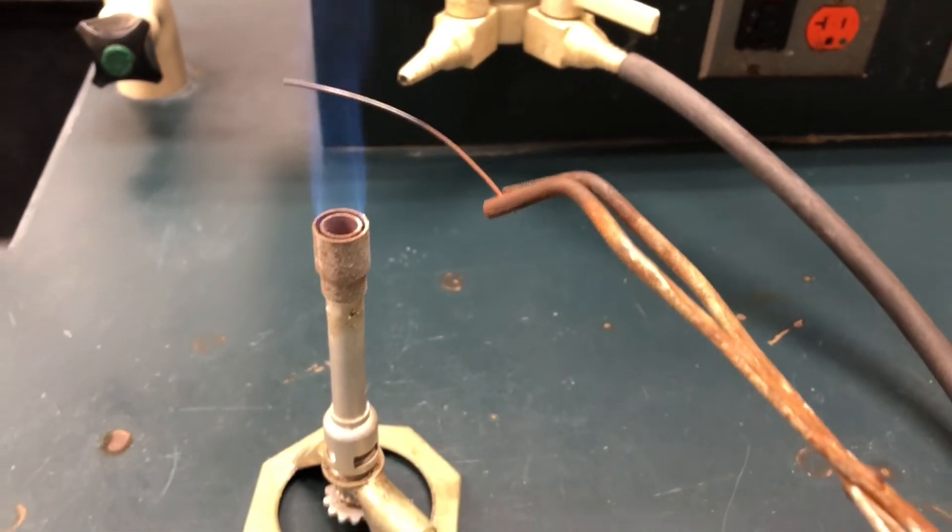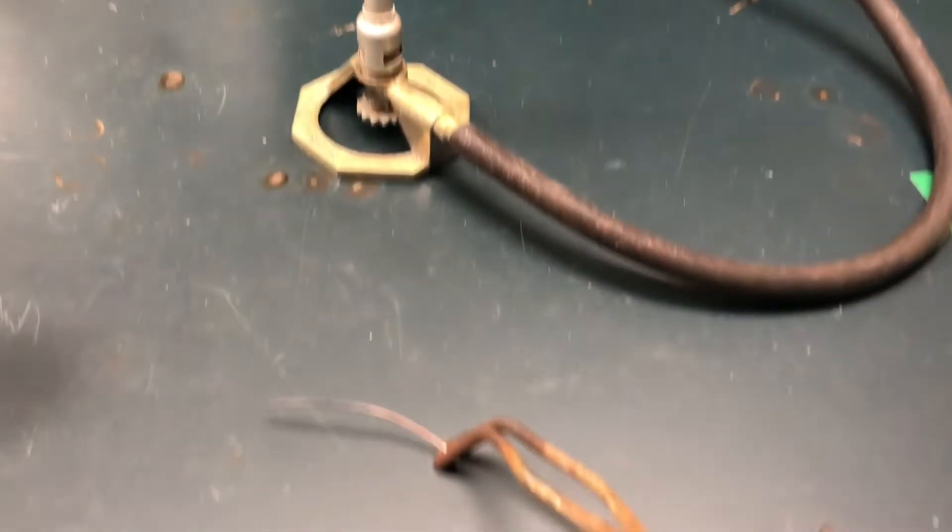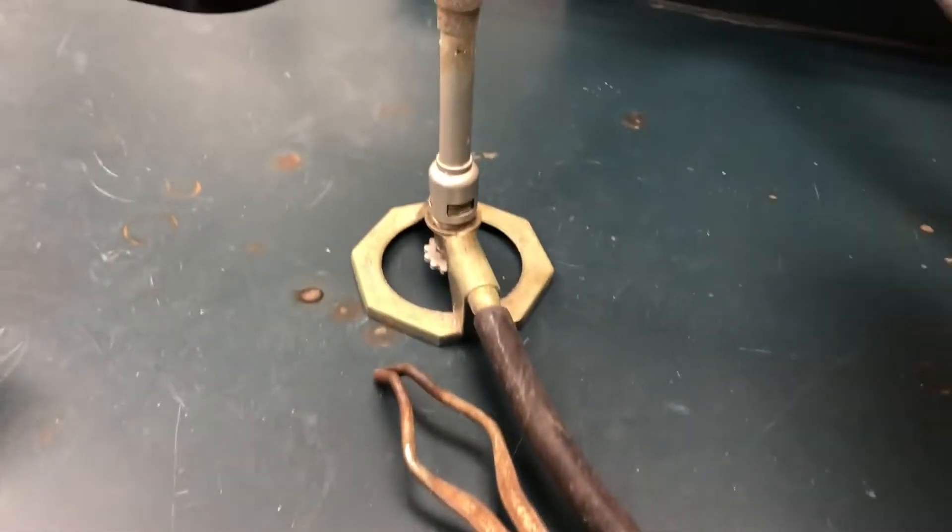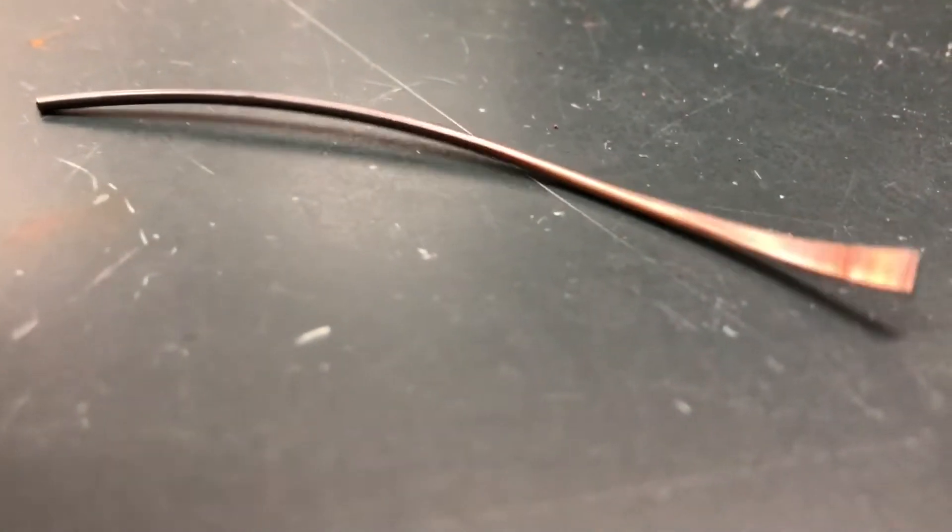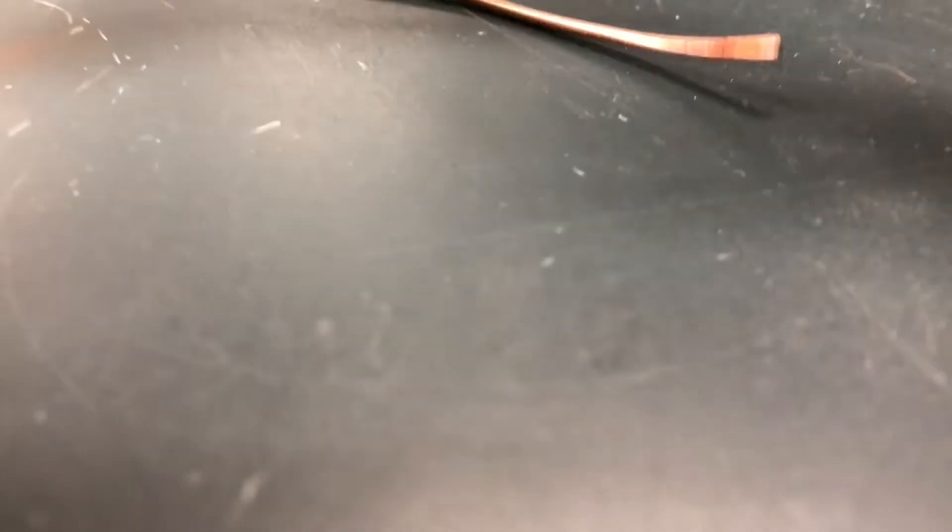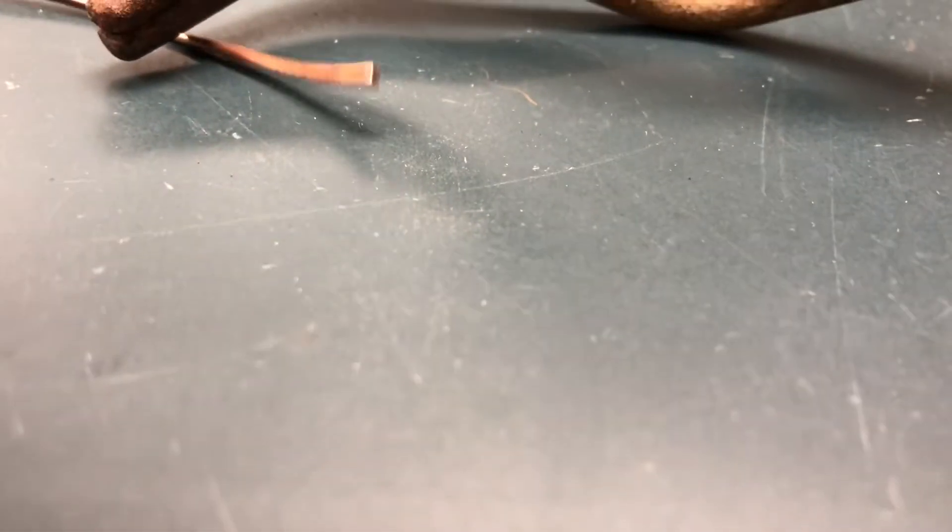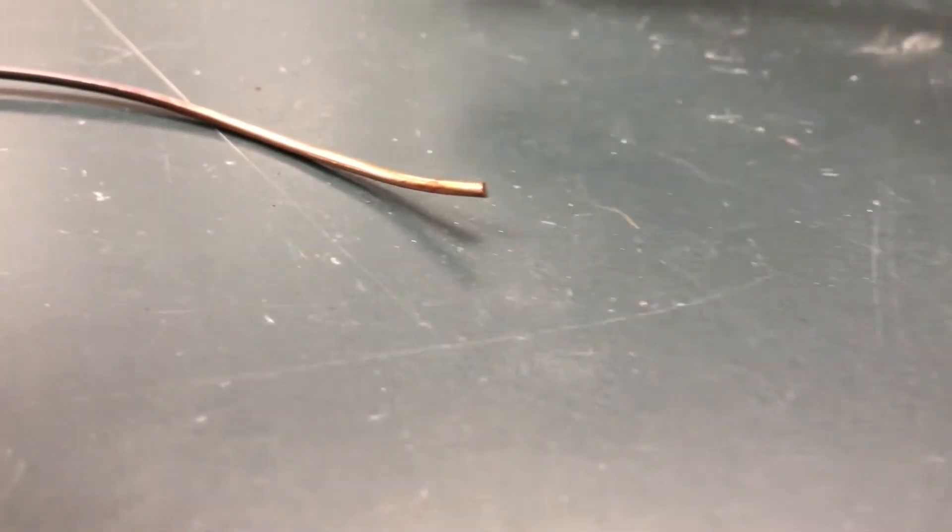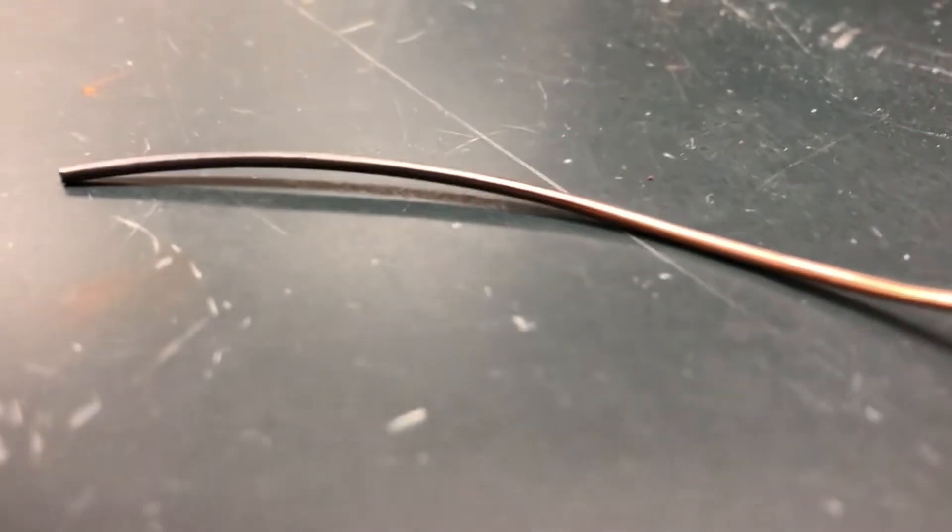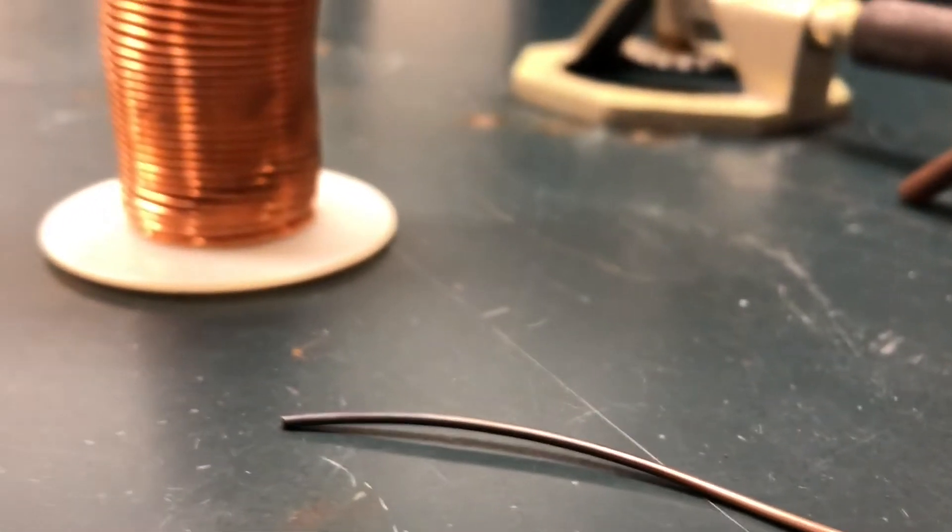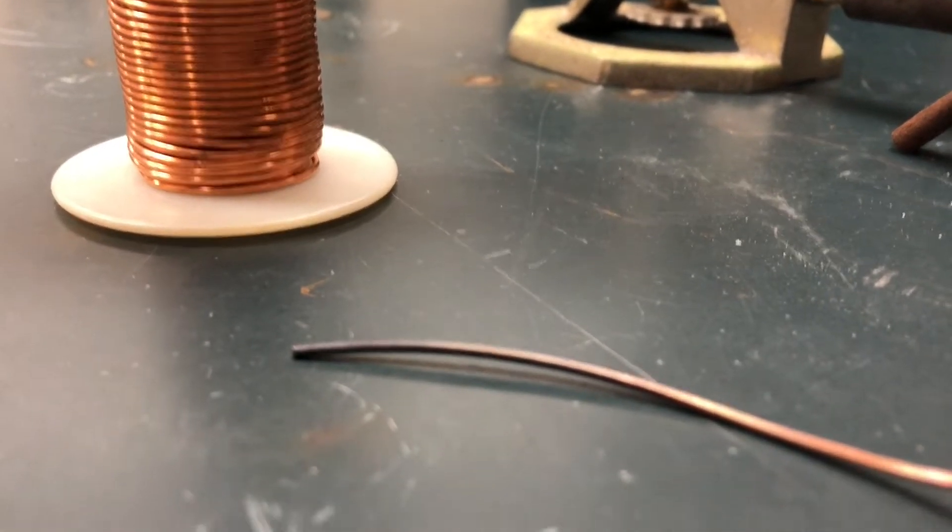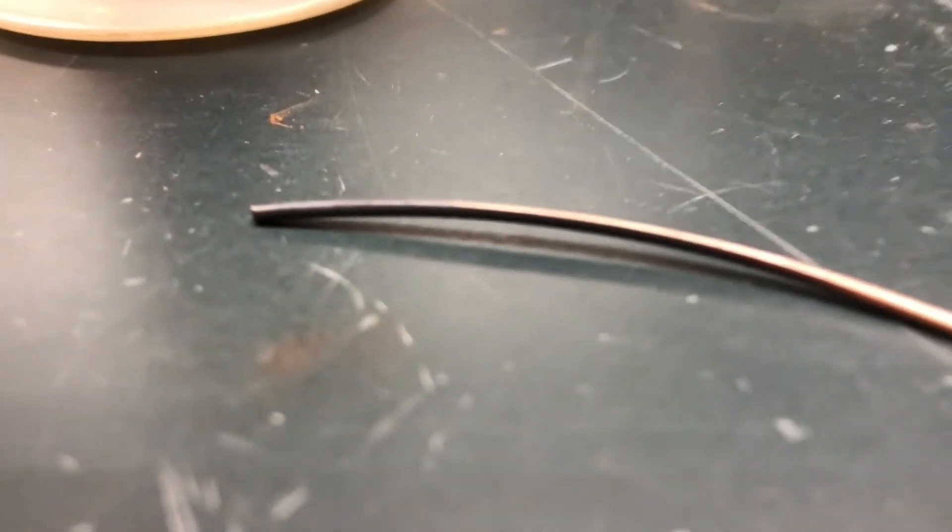All right, let's take a look at what we have. Let's turn off our gas and look and see our observations. Make some observations of what happened. There we go. If you remember it used to look like this and now this is our copper wire.